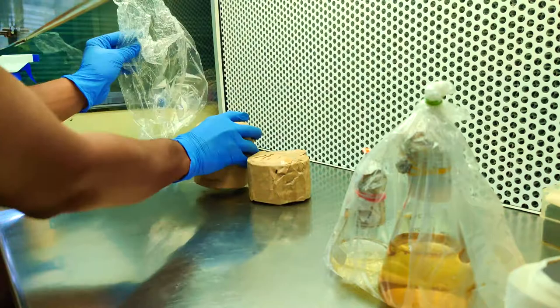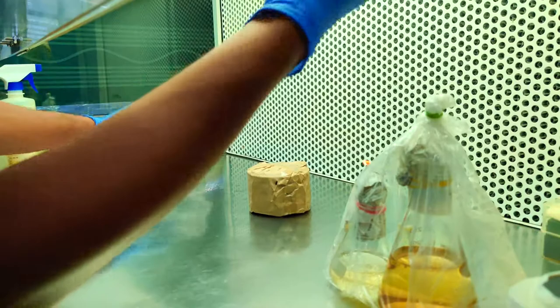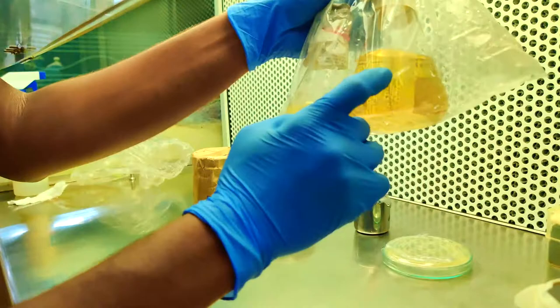Welcome. Today we are going to see how petri plates will be filled with agar medium. These are already autoclaved plates which I have packed and properly autoclaved with water using autoclave technique.